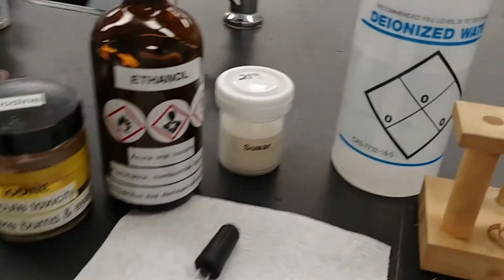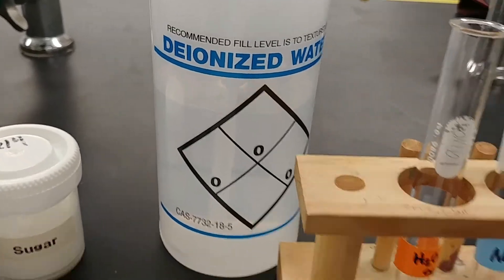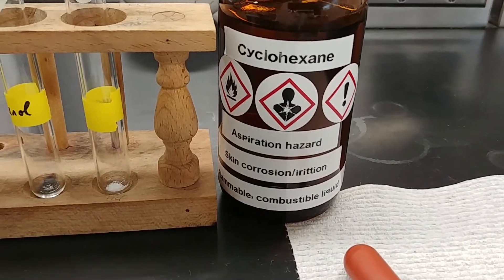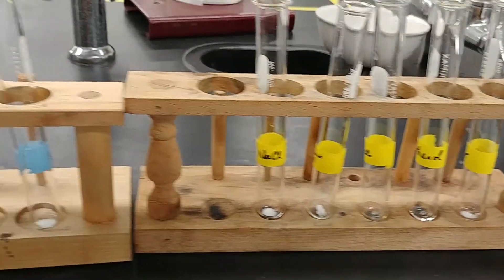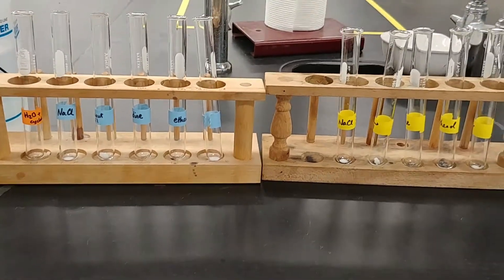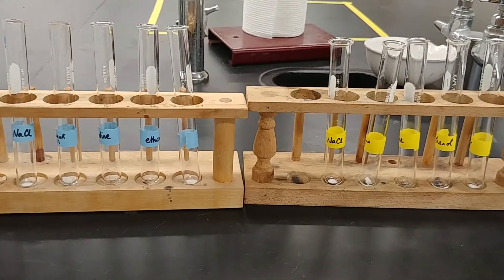So what we have is a polar solvent, water, and a nonpolar solvent, cyclohexane. We are going to be testing each of our solid and liquid samples, our solutes, in these two different solvents.